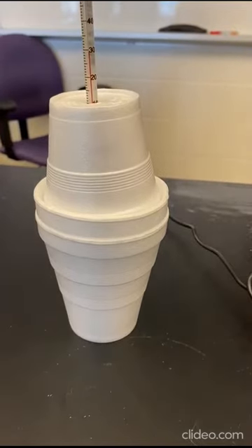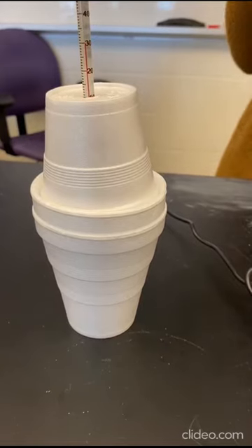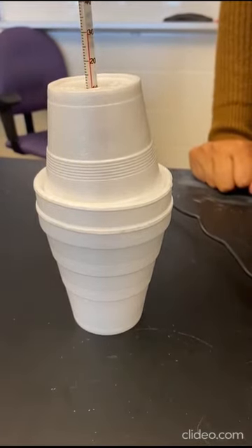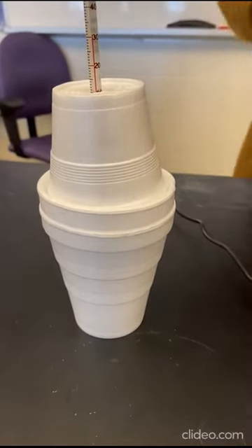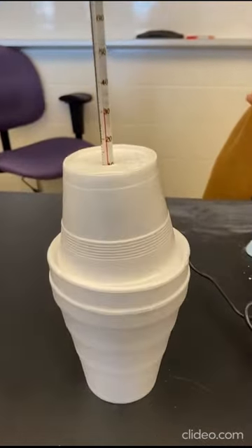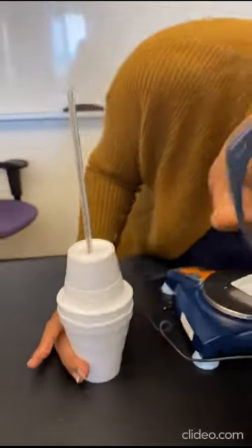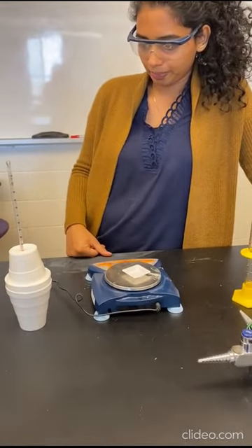And when you're doing this lab in person, you might notice that the temperature goes up and then comes down a bit. What I want you to write as your T2 is the highest temperature that it reaches. That is going to be your T2. Let's give it a few minutes. Okay, so it's been some time now, and we notice, as you can see, that the temperature is now 31.5 degrees Celsius. That is going to be your temperature for T2. All right, that's our lab.